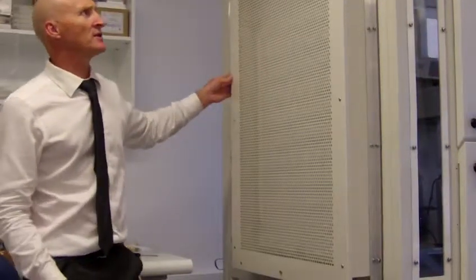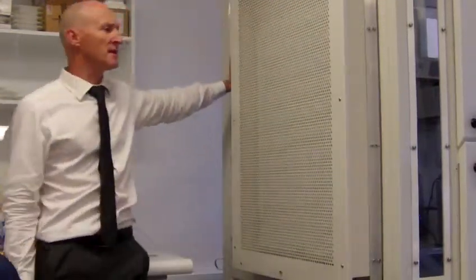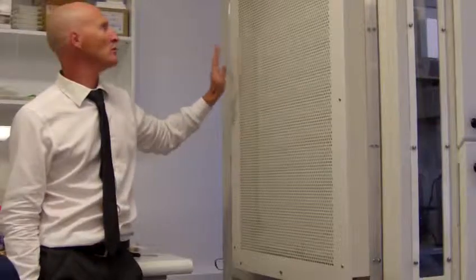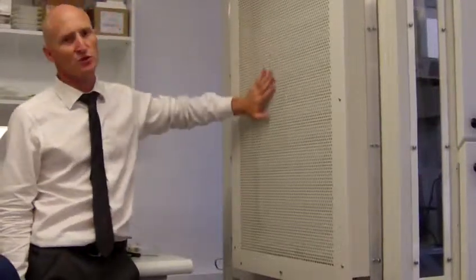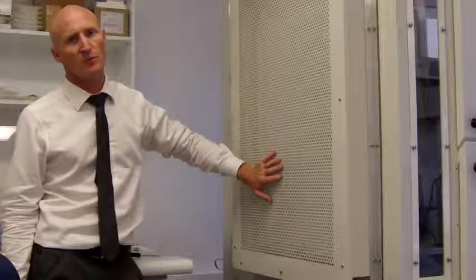So as I said, the first thing that you need to do is remove the plastic cover from the Bigneat. We did it this end. This filter could potentially be mounted at any point on the actual unit, so you could mount it on the back if you had clearance. Again, ensure you've got enough clearance so that there's enough airflow to come out. You don't want this pushed up against the wall, because that won't work.